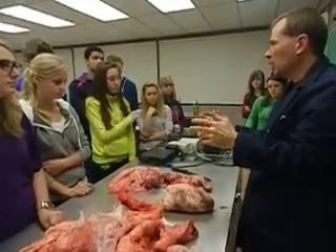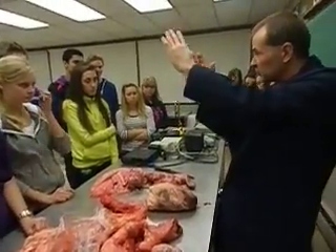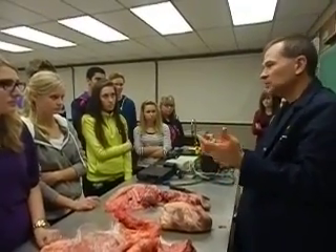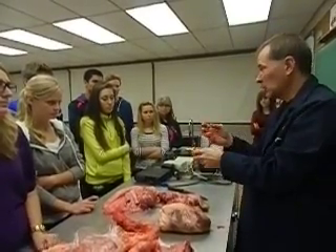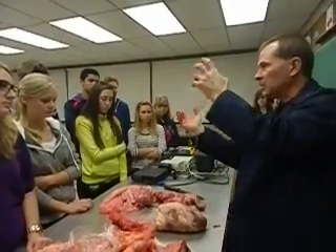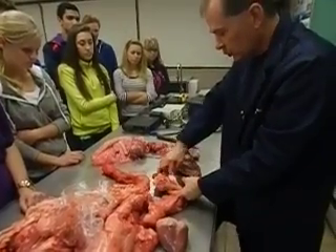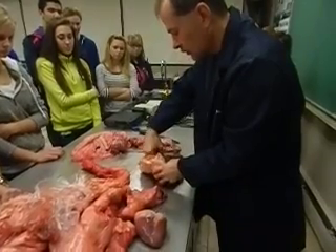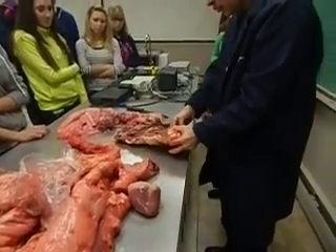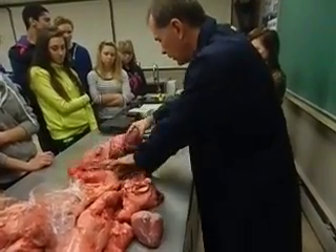You won't be able to make out where the valves are here, but you will be able to make out the chambers. You can definitely see the atria right there — notice it's kind of on an angle. And that would go into one of the larger chambers called the ventricle. Let's just try blowing a little air in there and see what happens. It's actually a bit ruined there so we're not going to be able to do much with it.